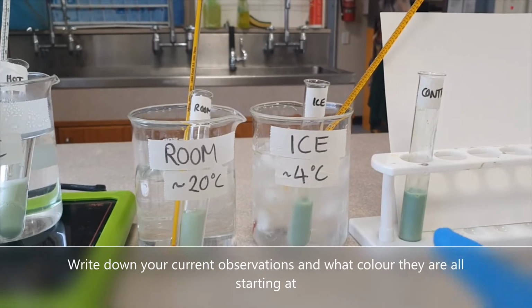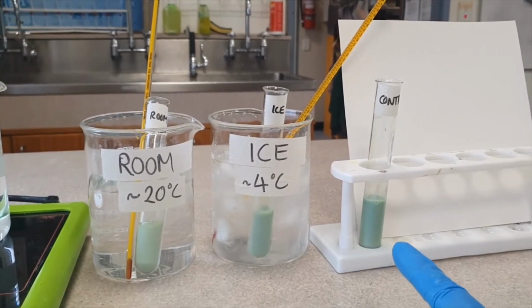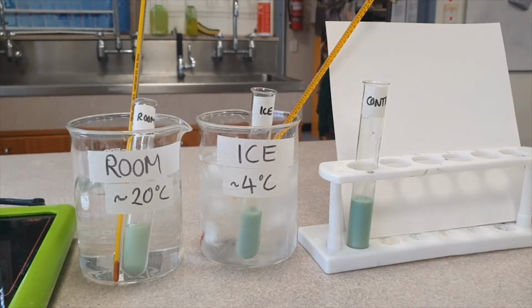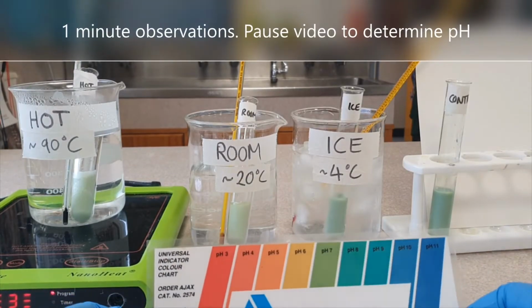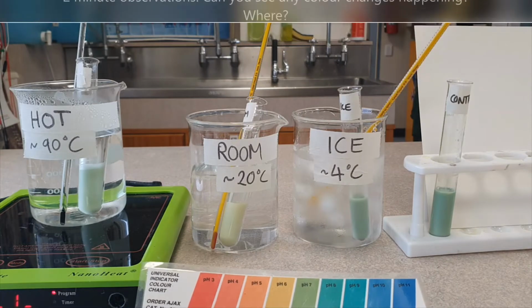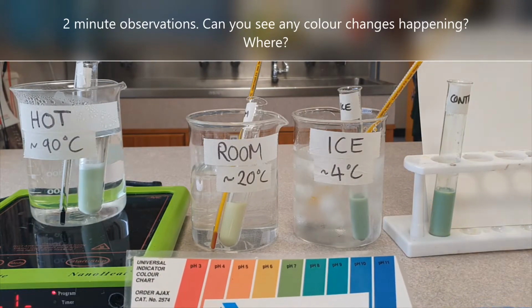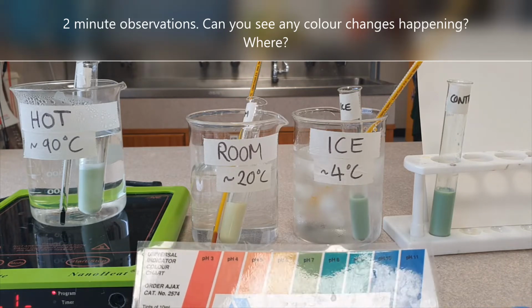Now, the control, I did not add lipase. I added 5 ml of water instead. Why do you think that is? It's been 1 minute now. Okay, so it's been 2 minutes now. Can you see any changes at the moment?